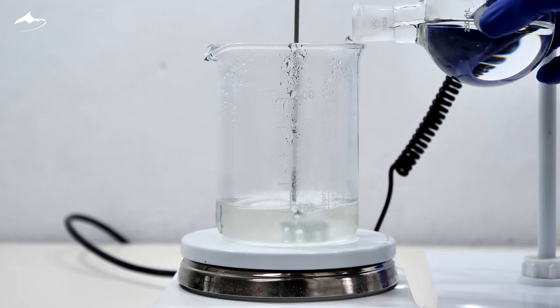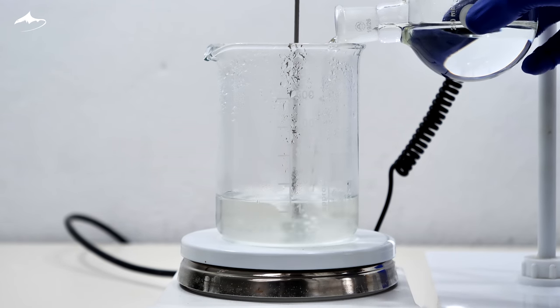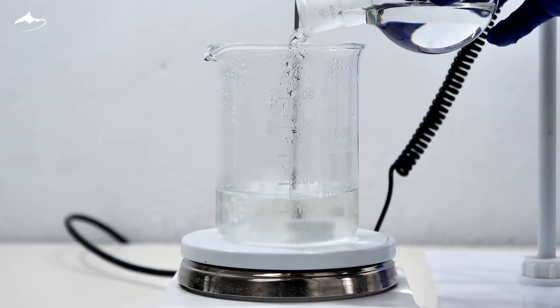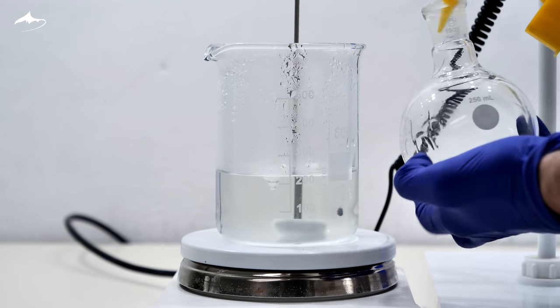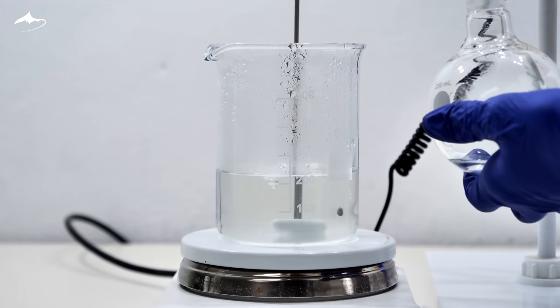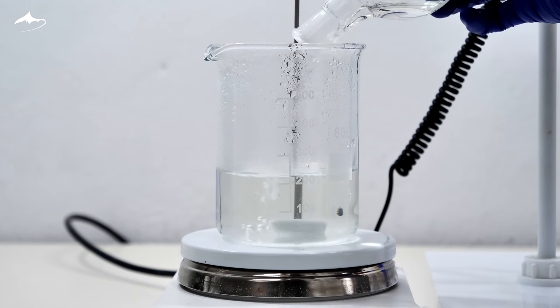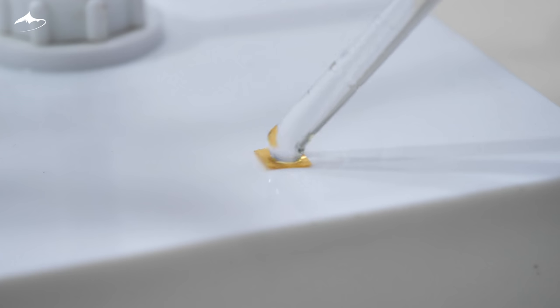Also, the extra distillate is added to that phase. It doesn't contain any organic phase, so, presumably, only a little of butyric acid is present, which again is converted into its conjugate salt, the butyrate, confirmed by a quick pH test.